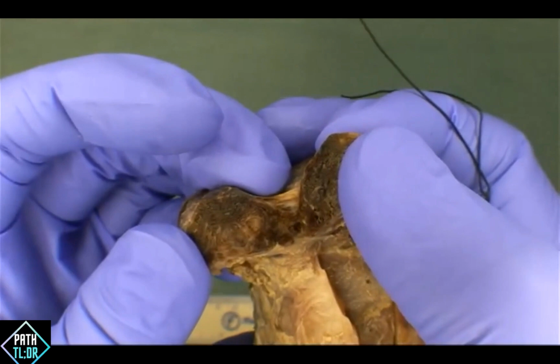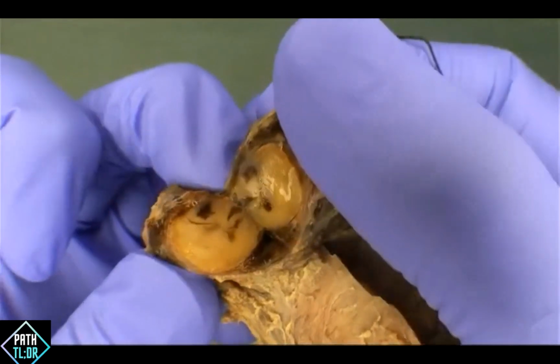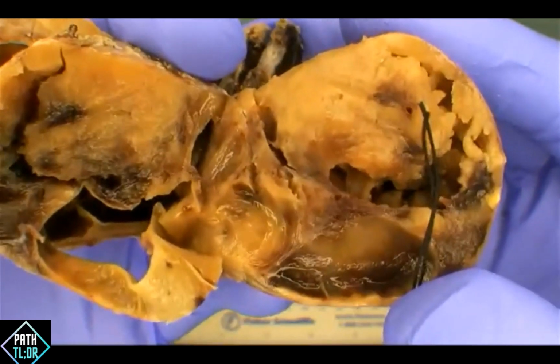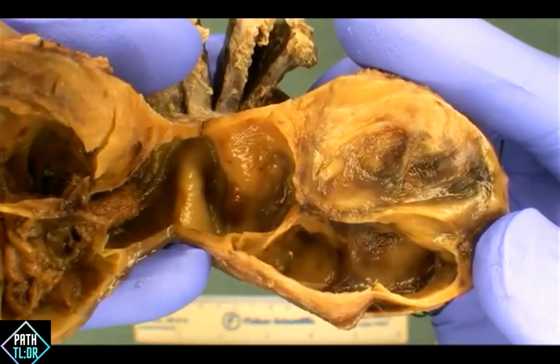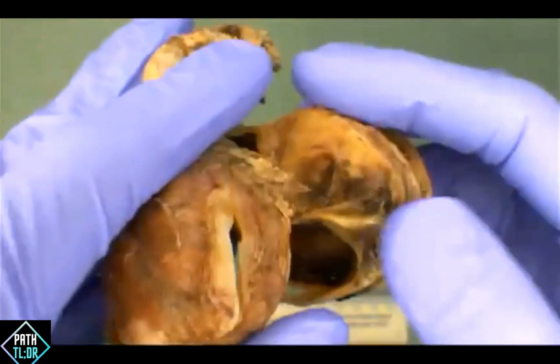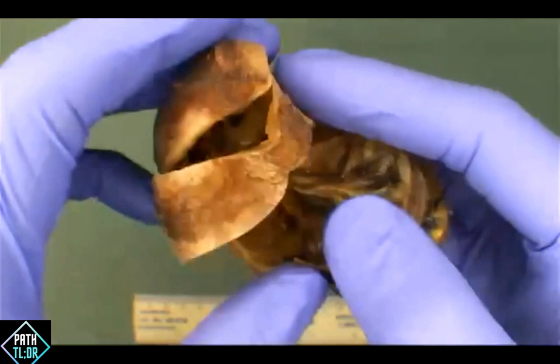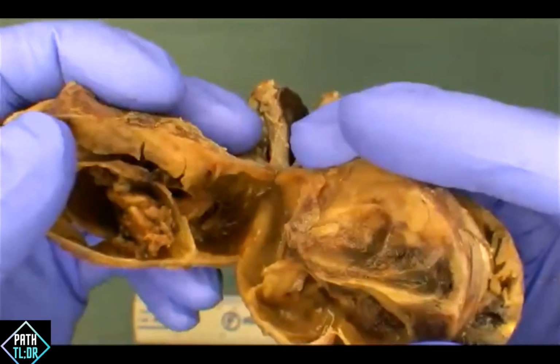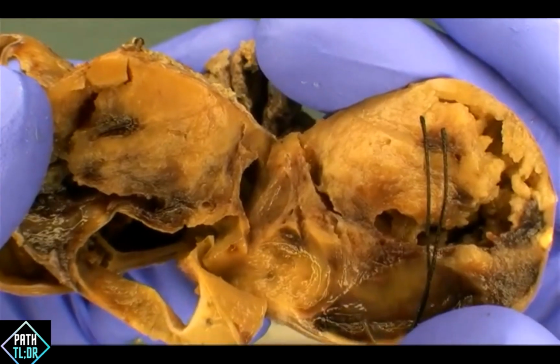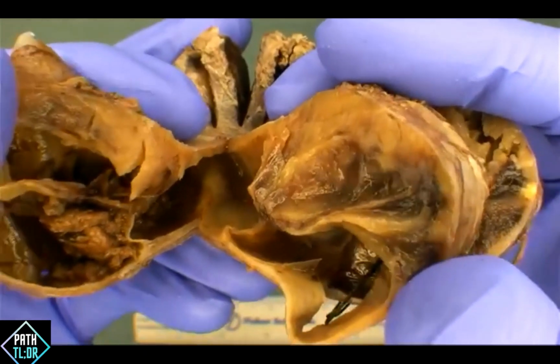Okay. So you can see on the left side, there's not a whole lot going on in terms of the cut surfaces until we get to here. That's near the isthmus? This is near the isthmus towards the inferior pole. Yeah. Here are some descriptors of this lesion now. That's very nice. Yeah. Multicystic, absolutely. Maybe some necrosis. We can talk about that in a little bit. So I'm curious, were there contents? Yeah, so there were definitely contents in this, and it was a bit of a viscous, dark red and brown fluid with some kind of chunky stuff in it, which I think was some of the stuff here. Good, so we've got glistening, we've got solid and cystic, absolutely. Okay, so really great descriptors for this lesion.